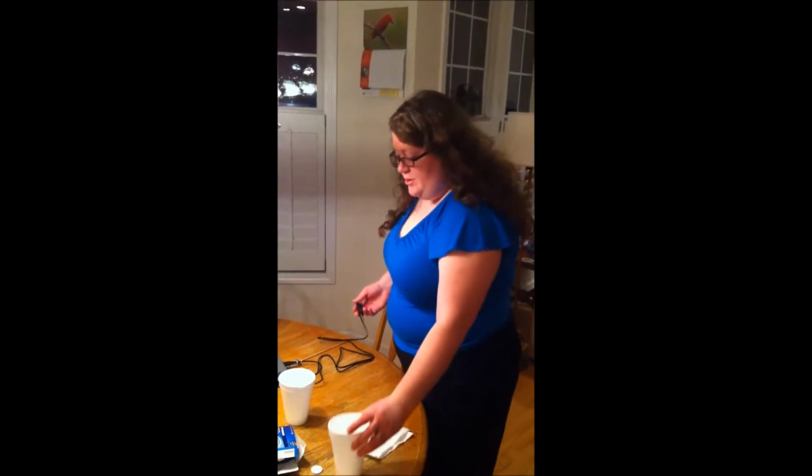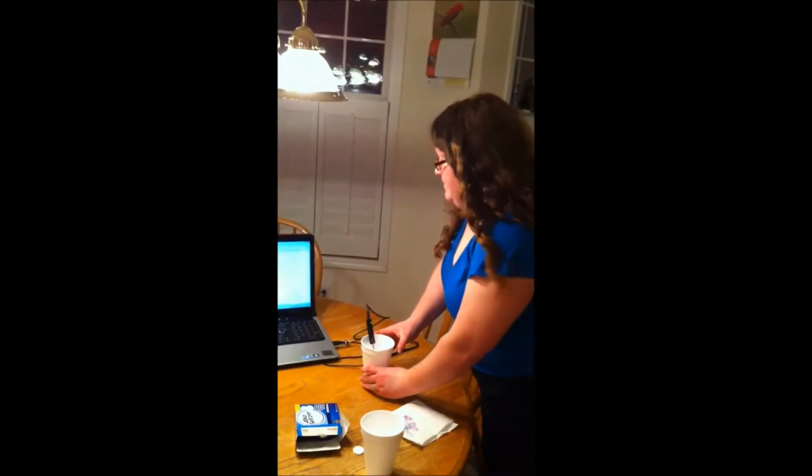All right, so now I have some hot water. Do you think using a hotter water will cause reaction time to increase or decrease? Dave? Increase. Increase? All right, so you think it's going to take longer for the reaction to occur? No, shorter. Reaction time shorter? It should consume all the energy sooner. So fewer seconds would be decreasing. Yes. Okay, all right, good.